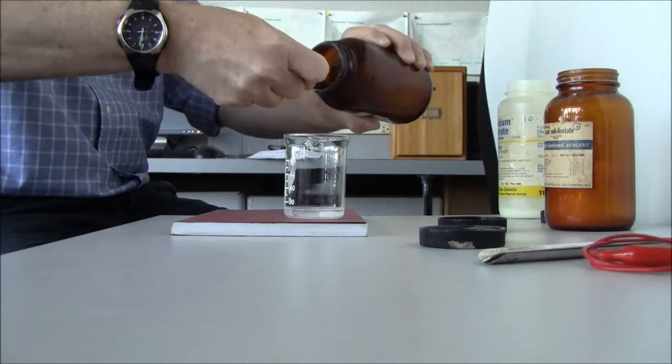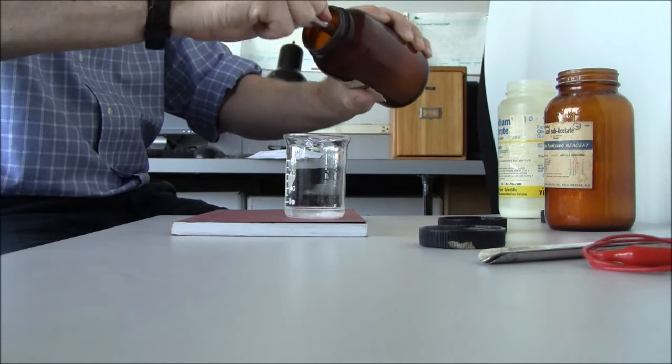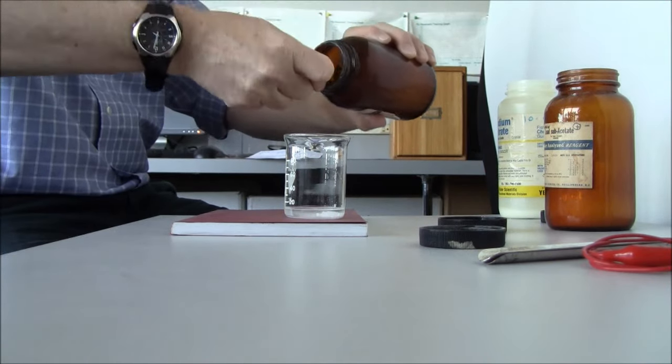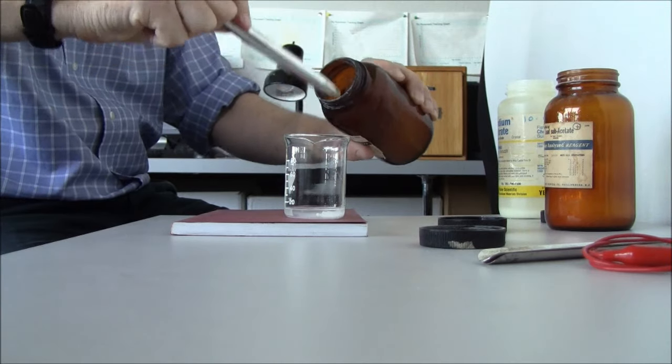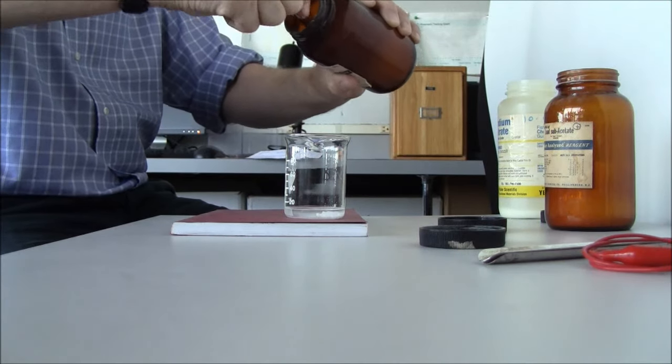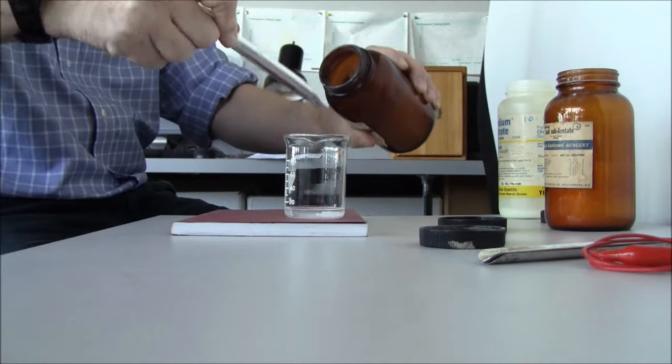Now it doesn't dissolve that well but I can't use water or any other polar solvent because that seems to set the footpad off. It will dissolve a little bit and it will dissolve enough for our purposes.